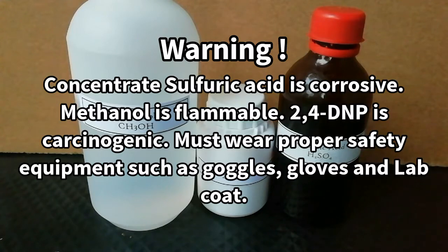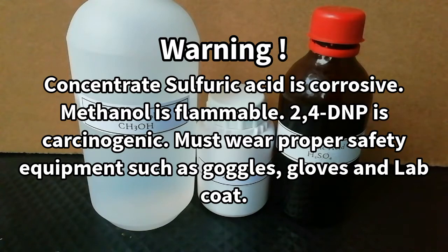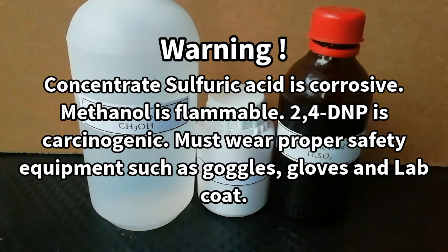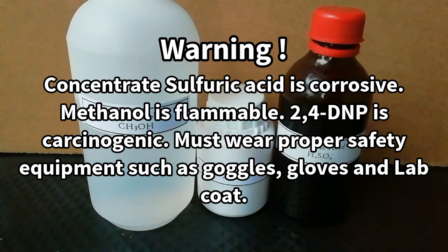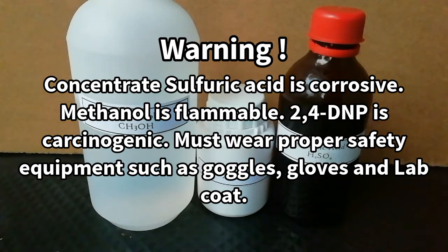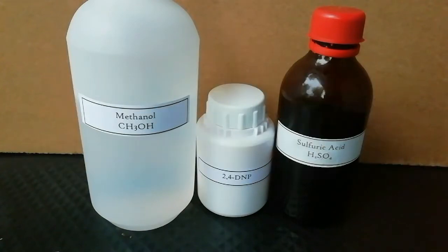Warning! Concentrated sulphuric acid is corrosive. Methanol is flammable. 2,4-DNP is carcinogenic. You must wear safety equipment such as goggles, gloves, and a lab coat.